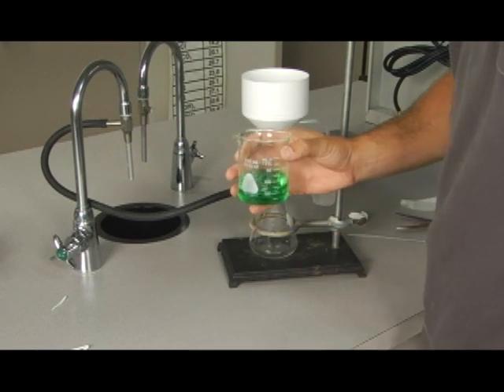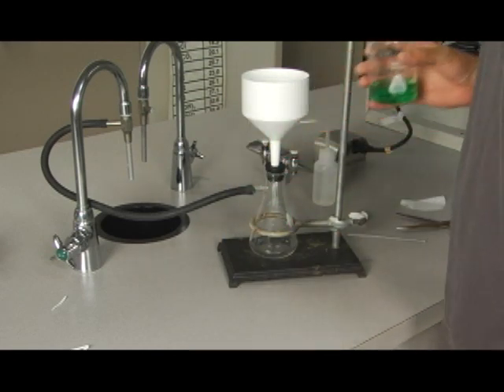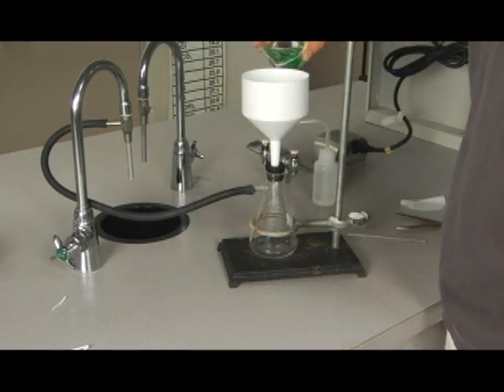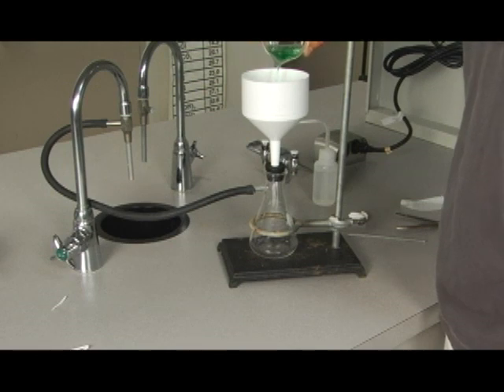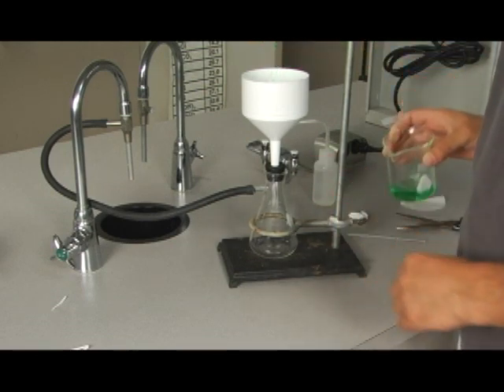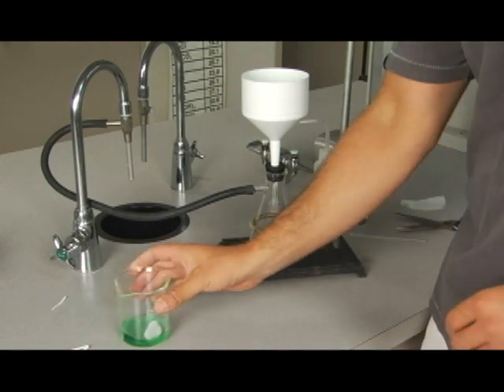The solution I have here is simply food coloring and water. When I place it into the filter, we see nothing coming through. No dripping at all. Now just very slight dripping, not very much.